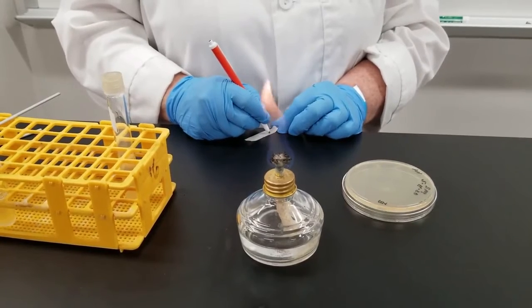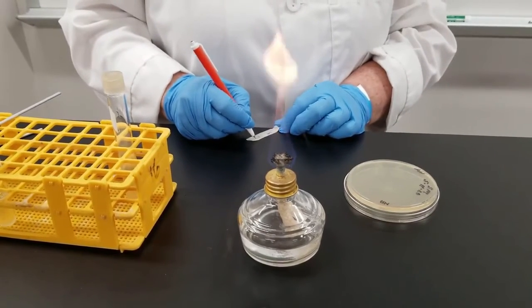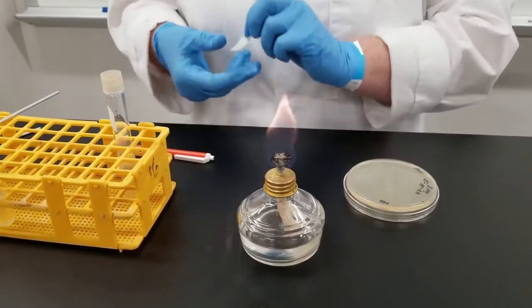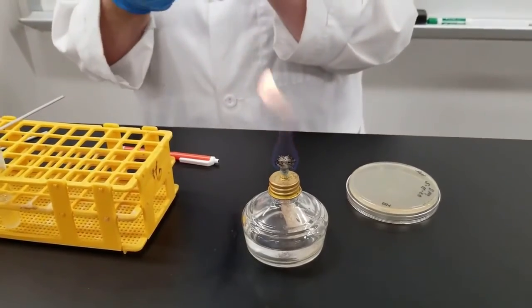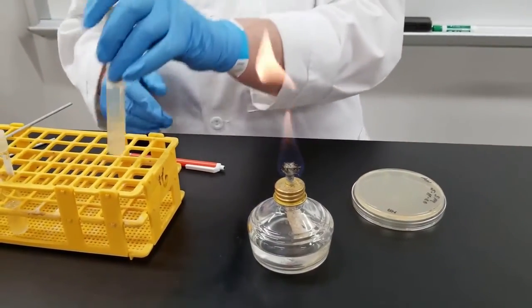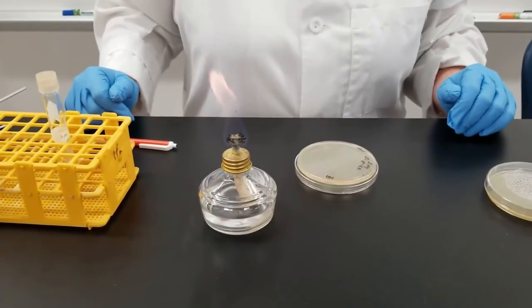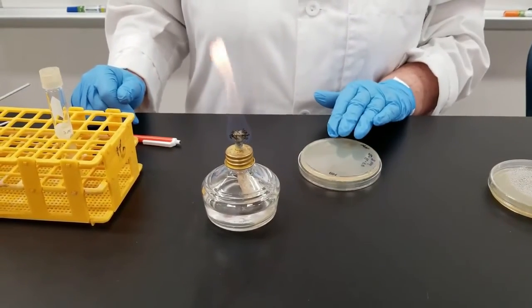So on my label, once again, I'm going to put the organism, I'm going to put the date, and I'm going to put my initials on here. And we'll just place that on the tube. Once again, that way there is no question about what is on your sample.